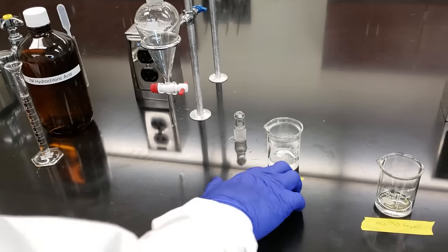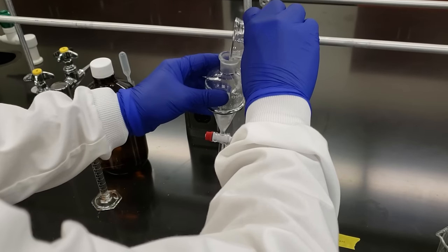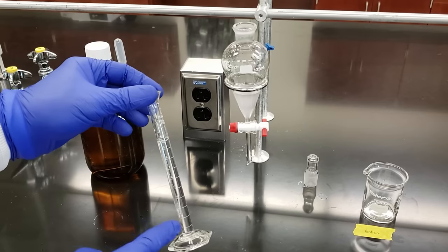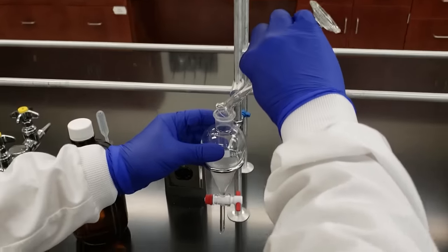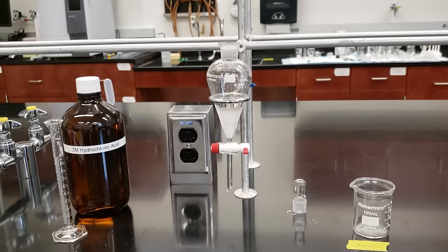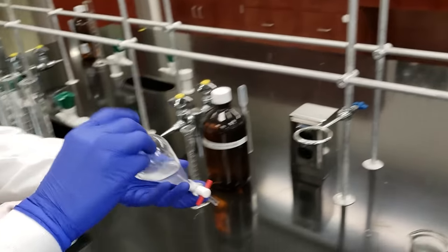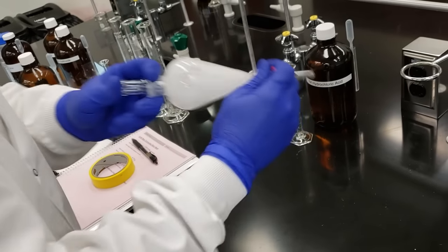For the next step, we're going to put our bottom layer — our methylene chloride layer — back into our separatory funnel. Make sure it's closed. We're going to take another 10 mL portion of 2 molar HCl and add this into our separatory funnel. We're going through the same extraction process twice: we extracted the methylene chloride once with a 10 mL portion of HCl, separated it off, and now we're adding a second 10 mL portion. We'll put the stopper in and go through the same shaking and venting extraction process.